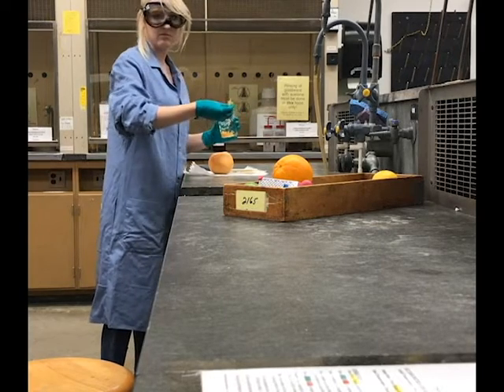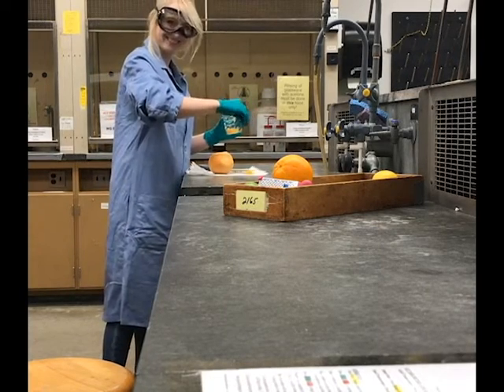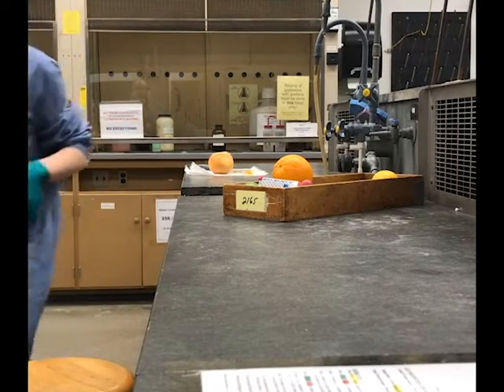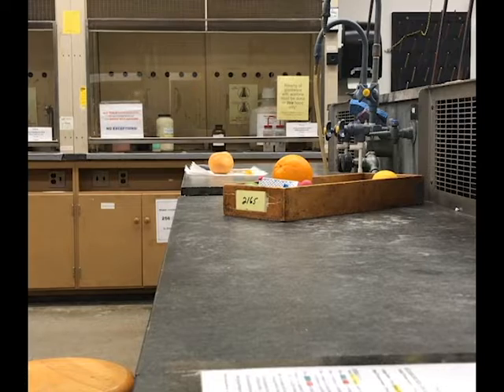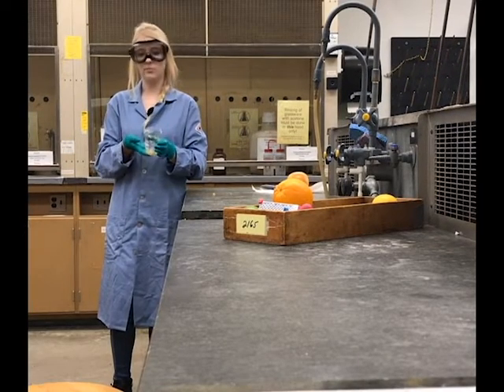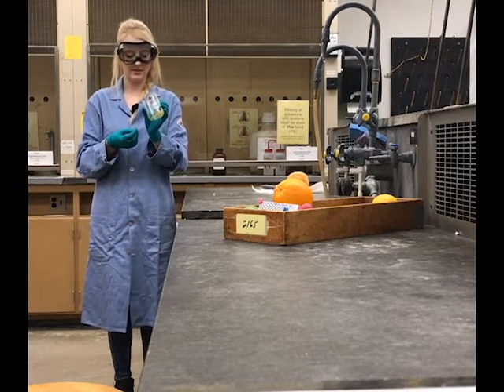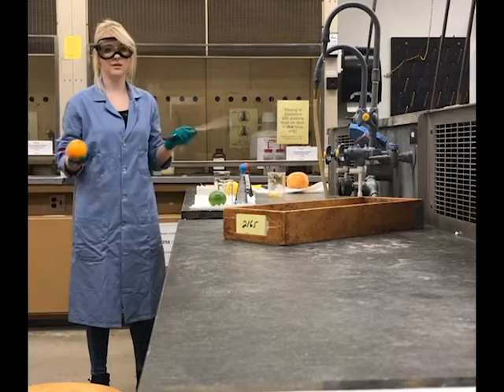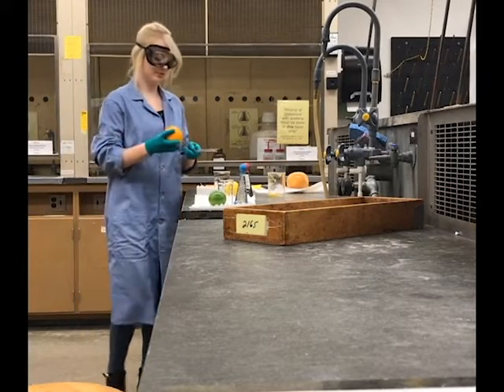And just, we'll try it again. So now I have obtained exactly 1 gram of the grapefruit rind. It didn't have to be exactly 1 gram, but it just turned out that way. All right, and now I will grate the remainder of the fruits.